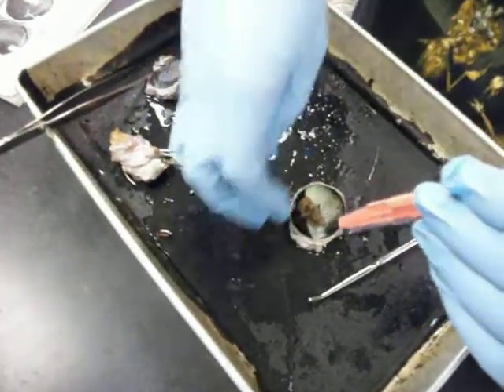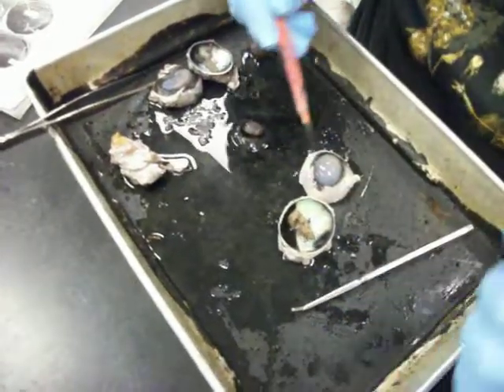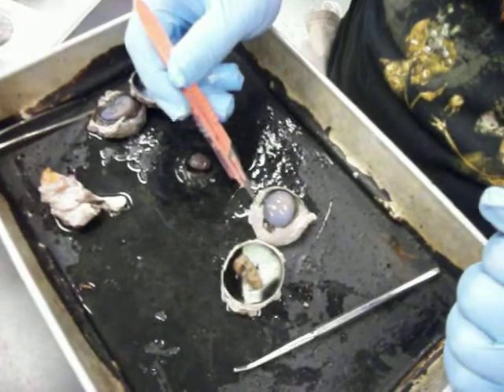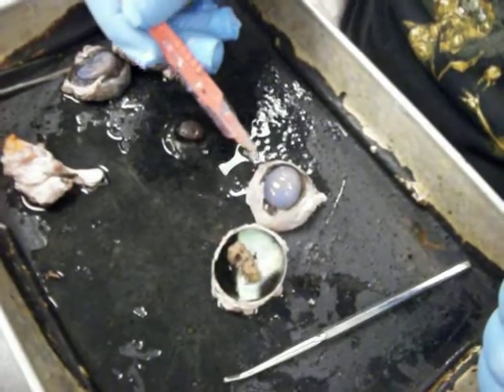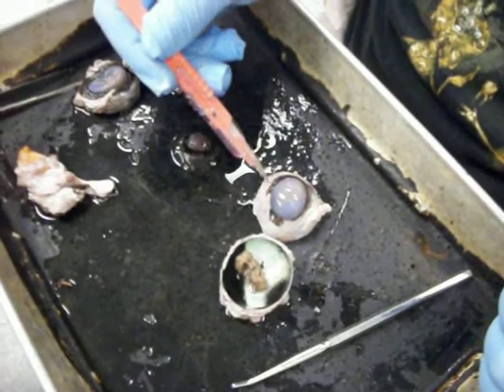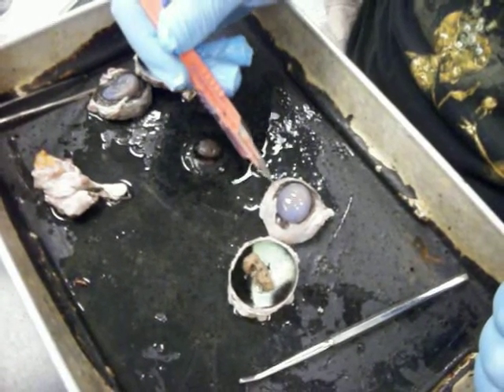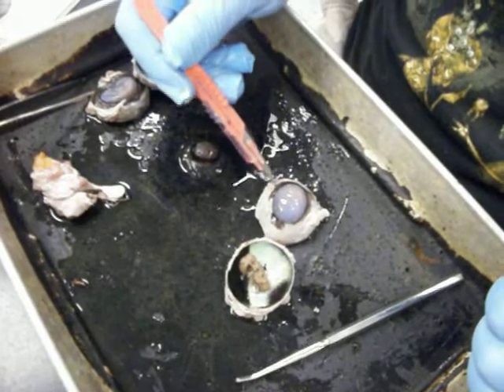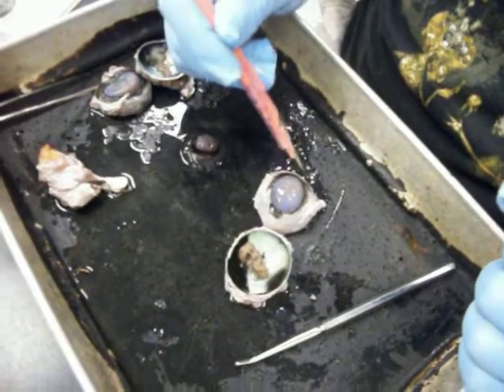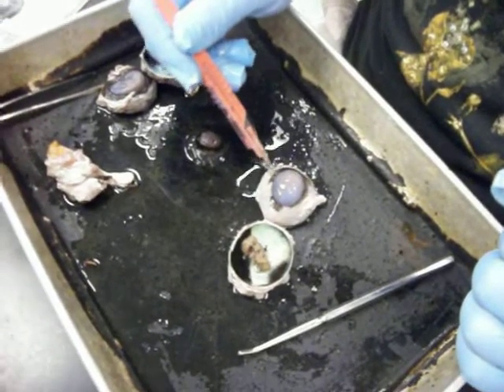When we flip over to this side, which is the anterior side of the front of the eyeball, we're looking at this little section right there. That is known as the bulbar conjunctiva. Definitely, the bulbar conjunctiva. Okay, so learn it.